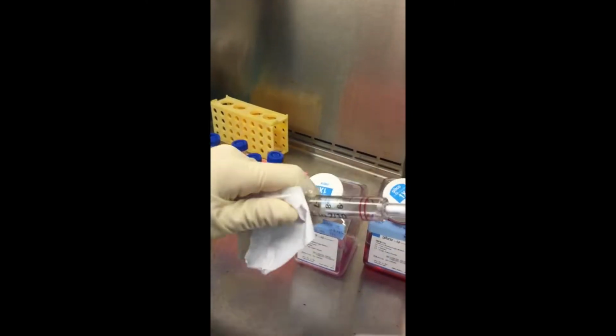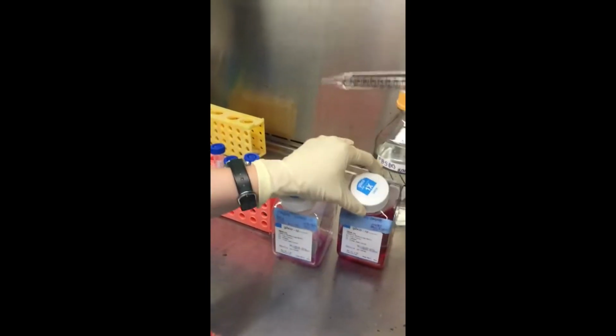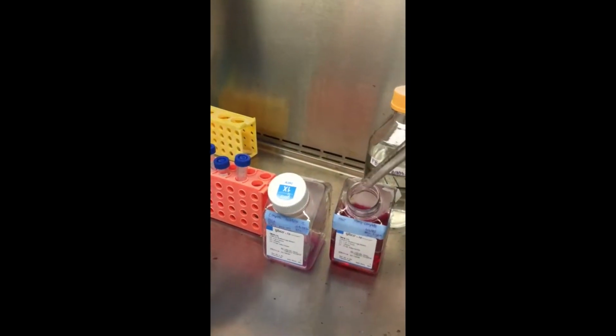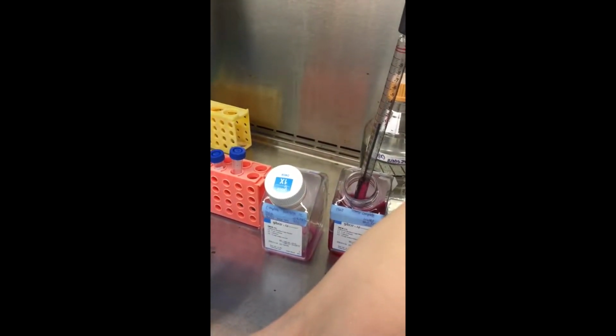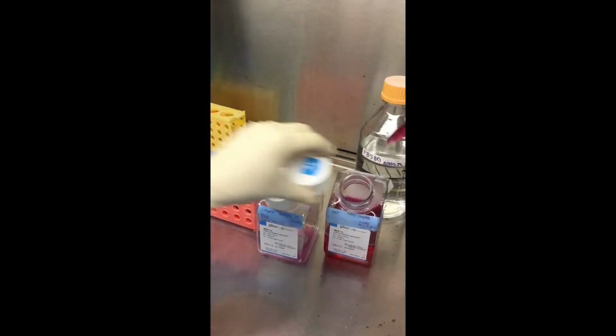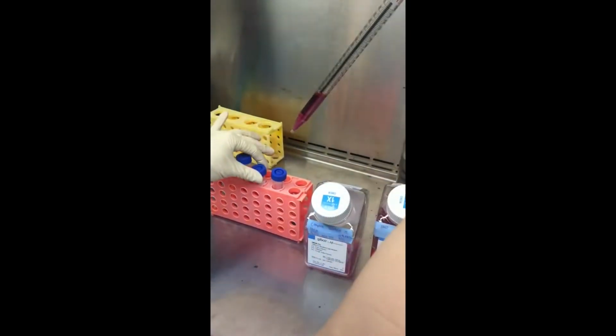Okay, so for the next 2, I'm going to pull the volume for both of them up in here. So I'm going to take 16 and then just let out 8 at a time. So try and do that whenever possible so we can save pipettes. And just, the trick is just to let it out really slow by not holding the button down quite as hard. And then you'll be able to read the numbers just fine. There we go.